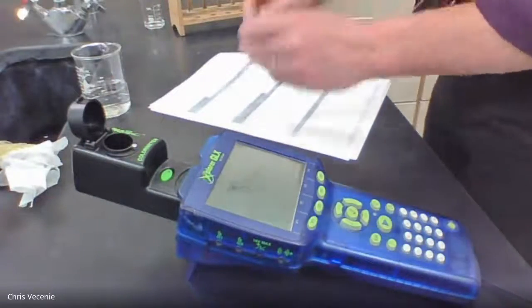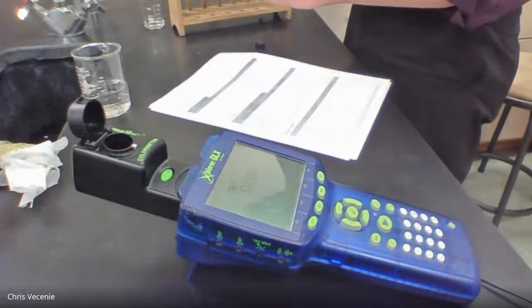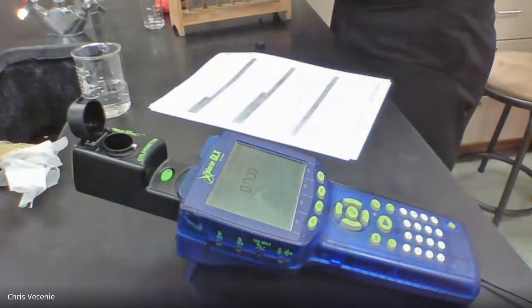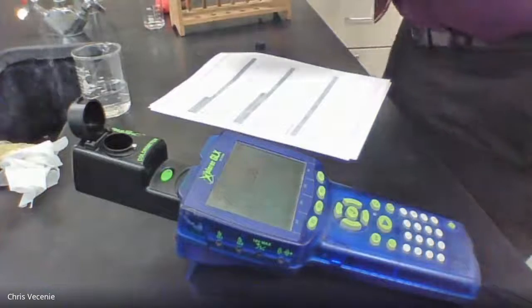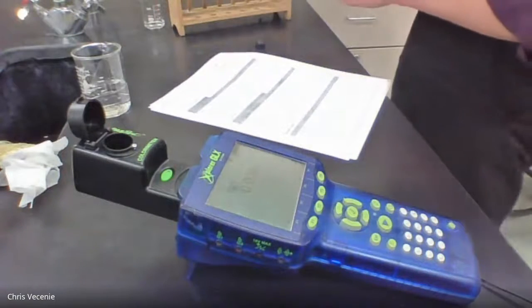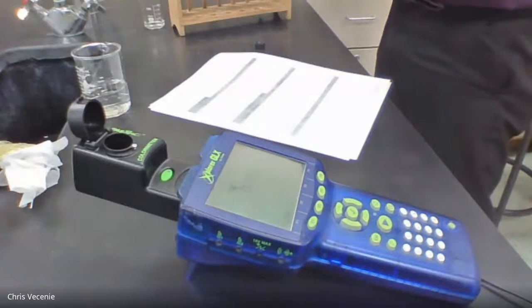All right, so now I'm just taking this guy and dumping him out. And giving him a rinse. Dumping that out. And then we're into test solution, number, let's go 4. Let's work our way from the bottom up. Let's get that guy out.